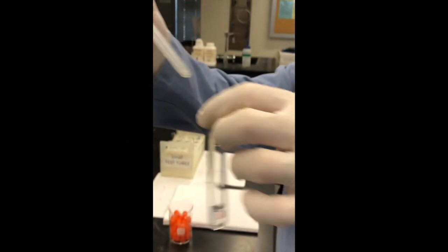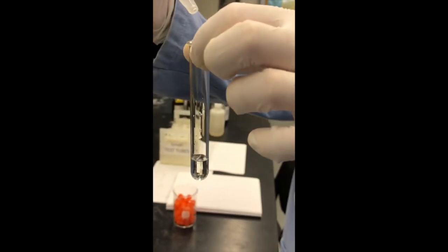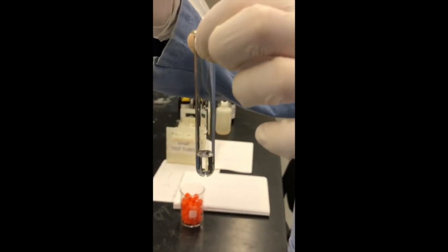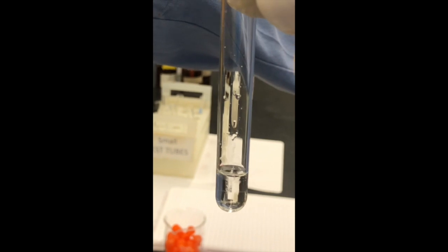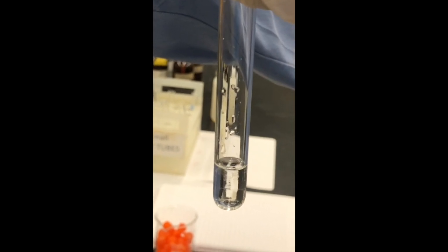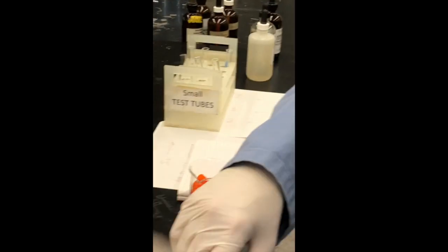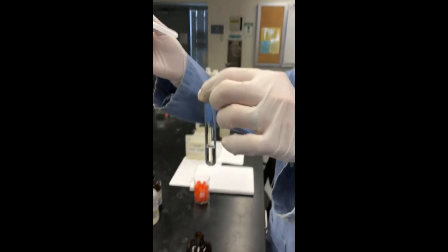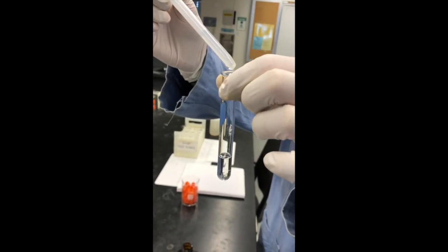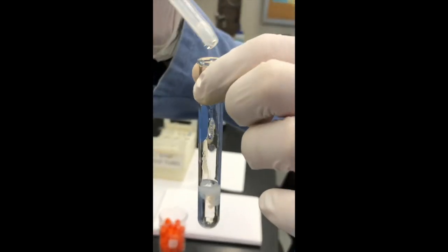Next, calcium ion using the same procedure. First, adding calcium ion to sulfuric acid, then calcium ion to sodium carbonate.